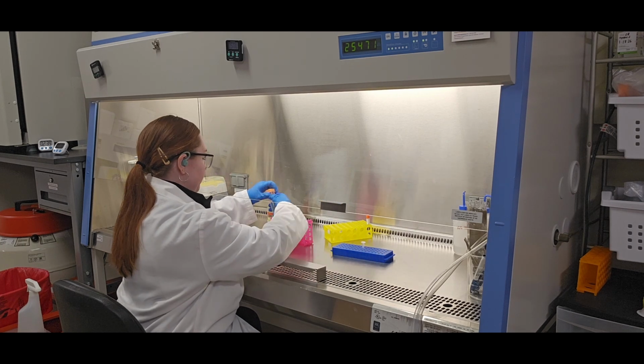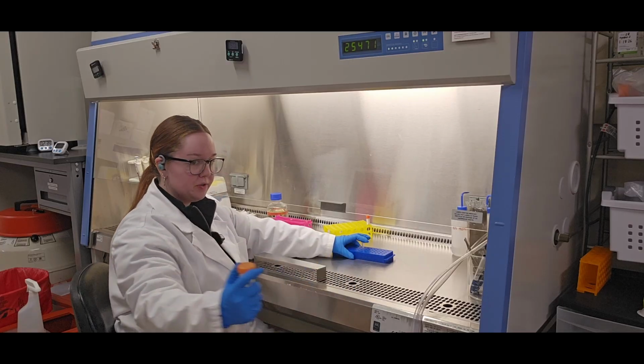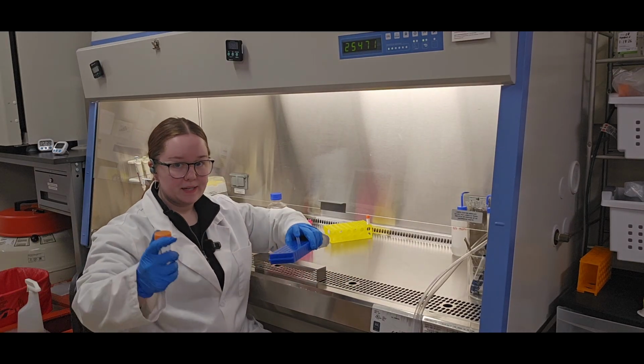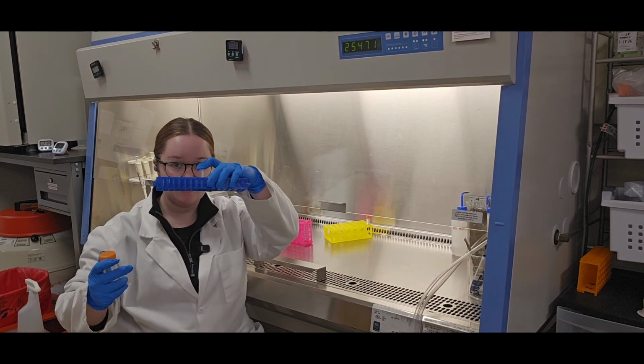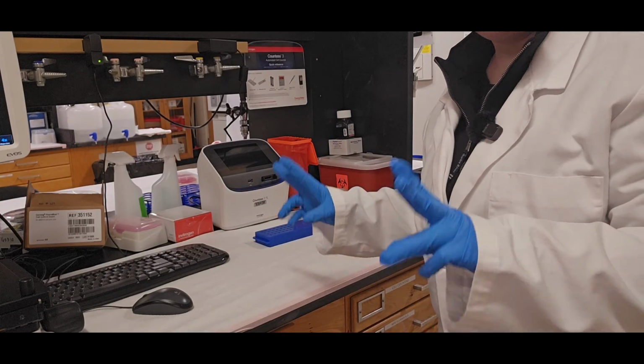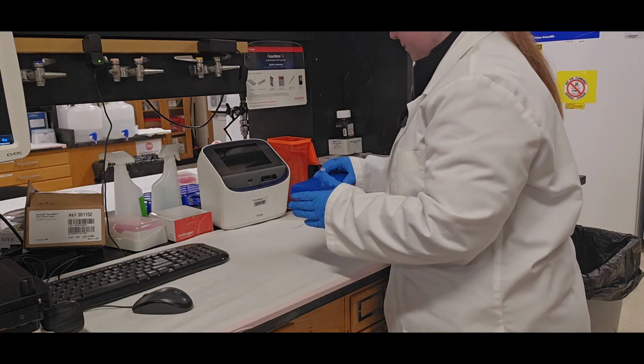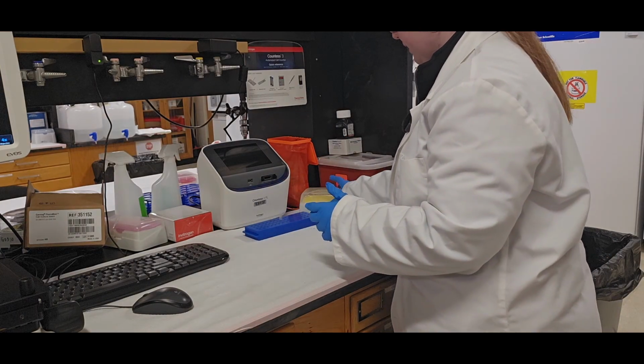A bunch of those are kept in our biological safety cabinet in the mammalian lab. So what I would want to do is, simultaneously as I'm going to bring my cell suspension to the centrifuge to spin it down, I'm also going to be counting this at the cell counting station. In the mammalian lab, our cell counting station is located next to the microscope. I bring the whole tube rack out with my sample and place it here.